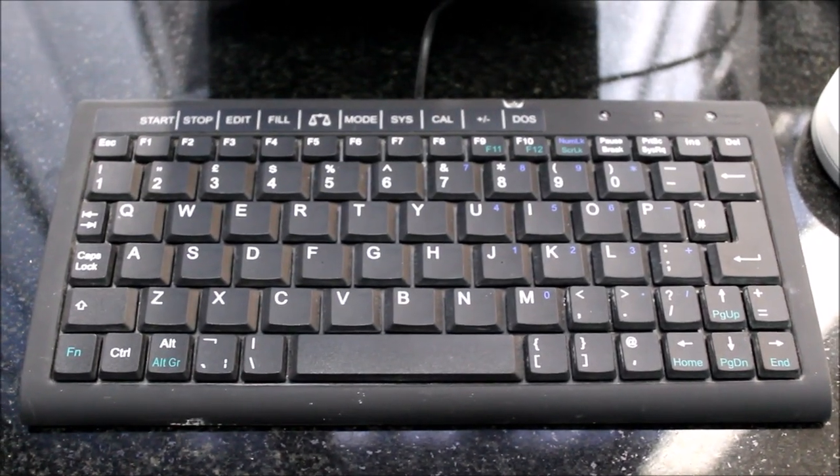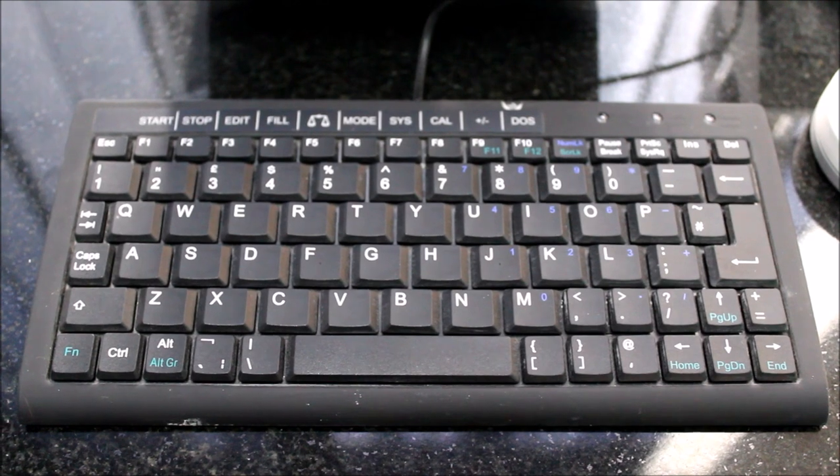One of the main accessories of this instrument is a mini keyboard which we'll be using to operate this machine.